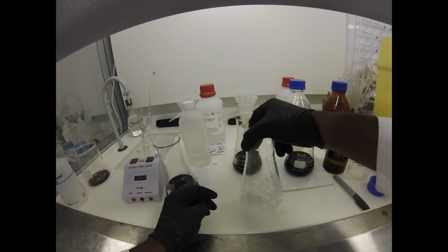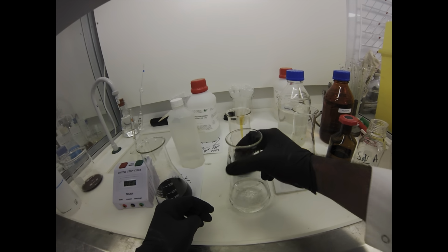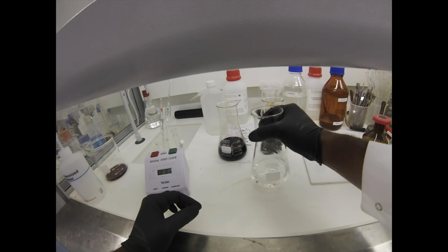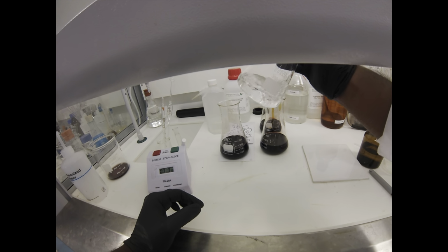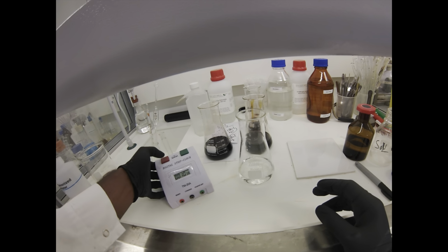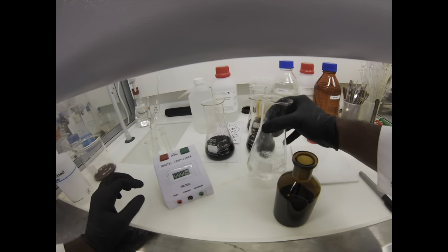I've probably doubled the amount of thiosulfate that I originally dissolved. Just going to have to make sure that is definitely dissolved in. In the A-level chemistry example that we were looking at, they're actually changing the concentration of KI, but I quite like to change the concentration of thiosulfate. If I'm demonstrating to GCSE, just add a couple of pellets in. Okay, so I think we're good to go now.